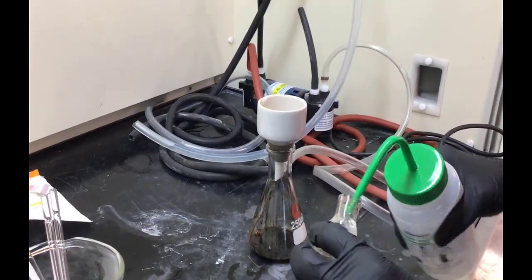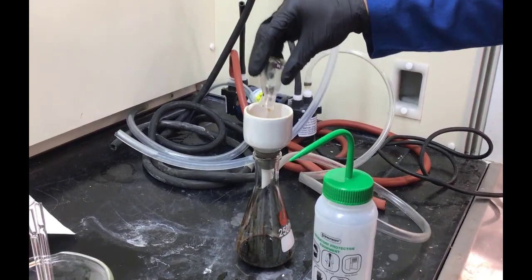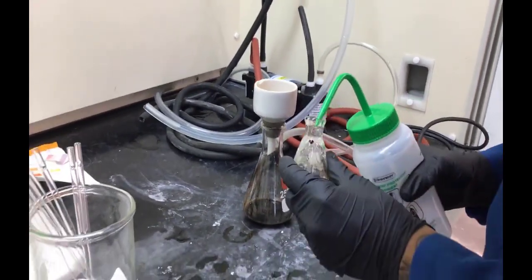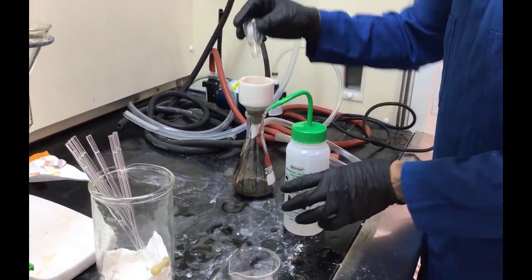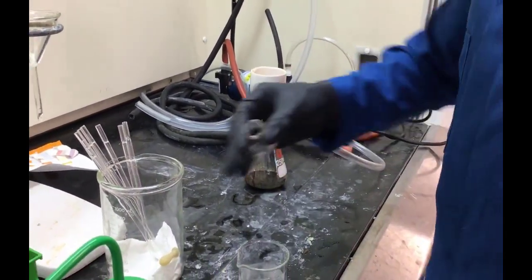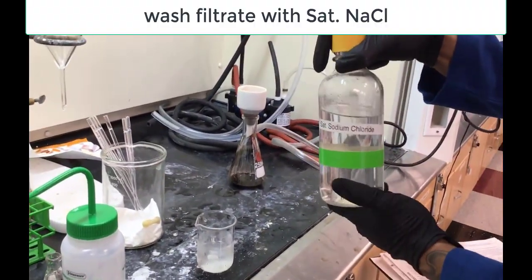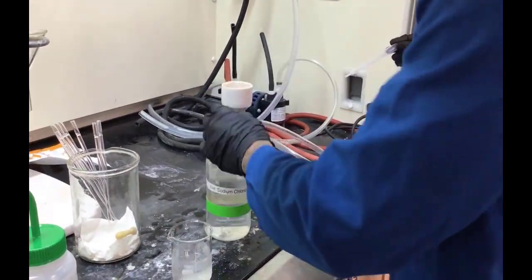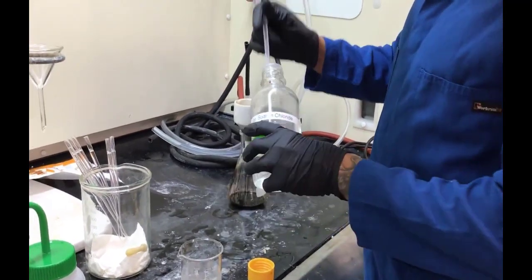All right, rinsing out their reaction container so they can get everything out of it, and then they're going to wash the solid that's in the filter paper with a saturated sodium chloride solution. We're about to see them grab it. All right, here, that is a saturated sodium chloride solution, and they're going to add about 2 milliliters of that to wash the solid crystals.